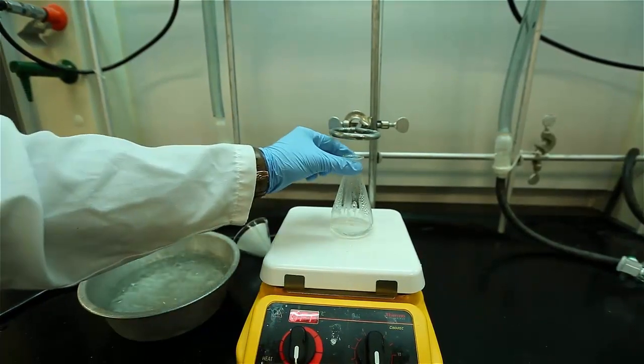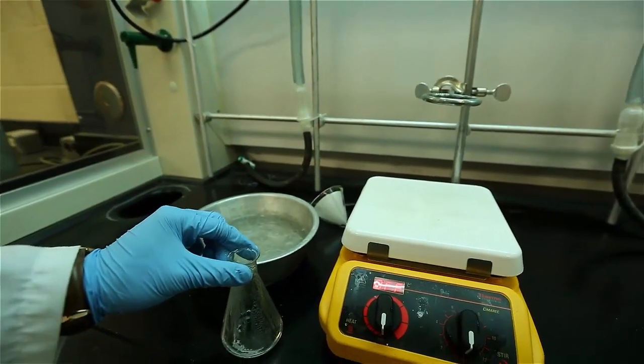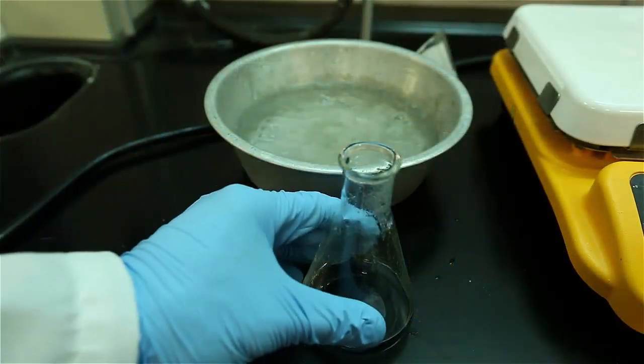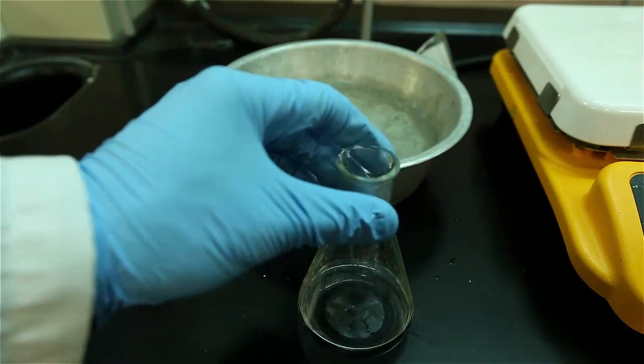You will have to prepare an ice bath using a beaker or an aluminum pan to contain the ice water mixture. Allow the filtrate to cool to approximately room temperature first, and then further cool in ice bath.